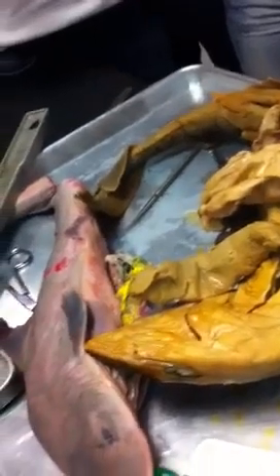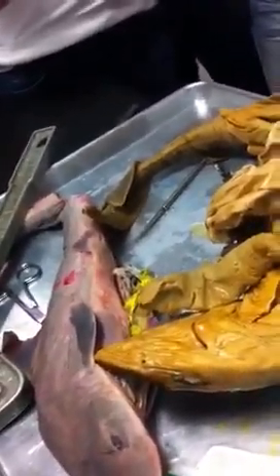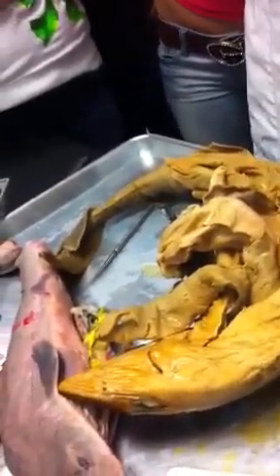So the testes must be connected somehow to the cloaca so that sperm can be delivered via the claspers to the female's cloaca. And the female must have paired ovaries, so I'm going to look for a female later, and potentially a uterus. You guys know about these different ways that sharks have of reproducing. There's 3 different options for sharks. And you have a table in your manual that compares those 3 options, right?